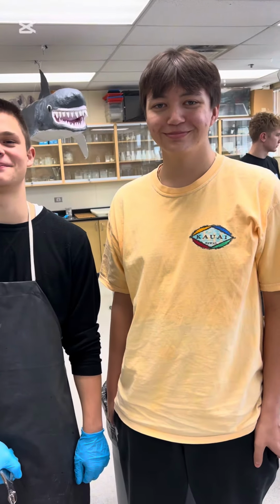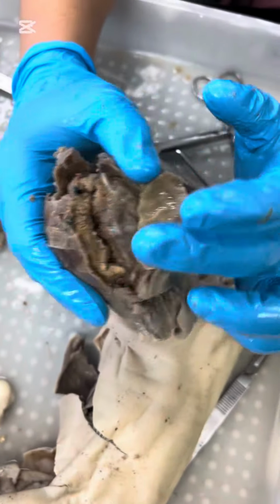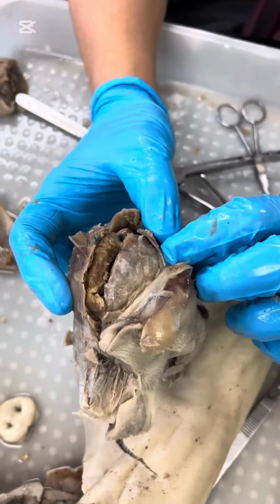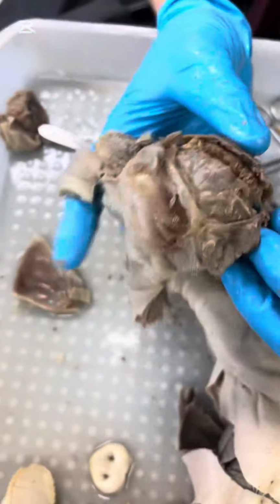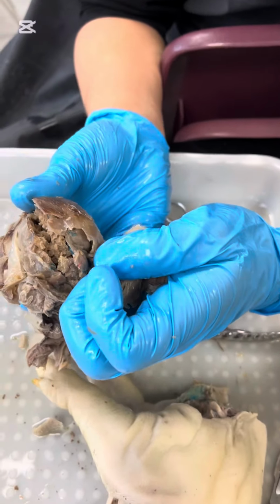We're doing the nervous system, featuring a random Cambodian man. So, as we can see right here, I had a little bit of difficulty getting the brain out of the skull. It is a bit mushed. So, as we check the brain right here, you can see the prefrontal cortex is right here. The thalamus will be somewhere down in the left, down to this part of the skull that I have not yet uncovered. And the cerebellum would be somewhere down here in the lower region of the skull. So right now, I'm just trying to get that extracted, and yeah.